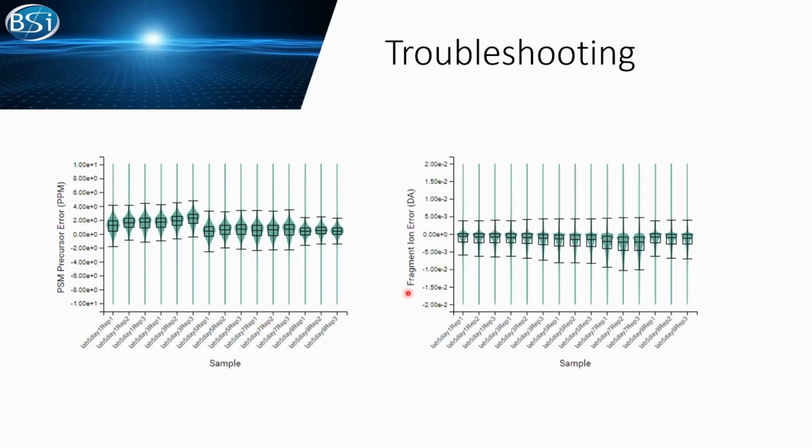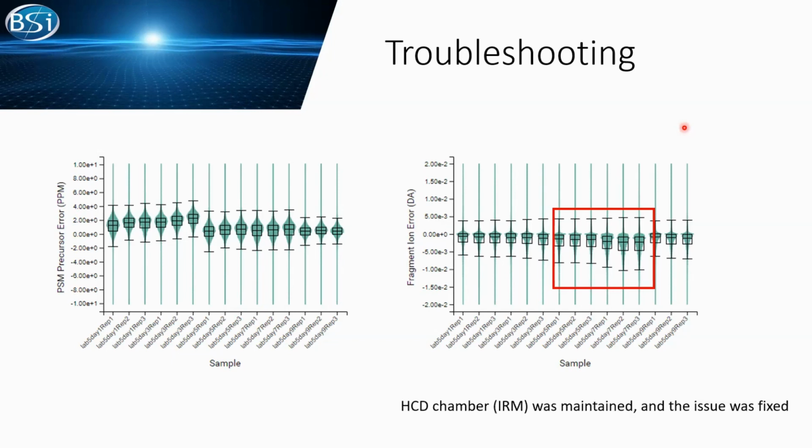But from the fragment error, we are seeing something interesting. In these runs, not only do we have a high error in our MS2, we are also seeing that the distribution is uneven. That suggests our error is not on the detector. It's probably somewhere else, maybe the fragmentation chamber. In this paper, actually at the end of day 7, the HCD chamber, the ion-routing multipole, was maintained, and you can see on day 9 the issue was fixed.